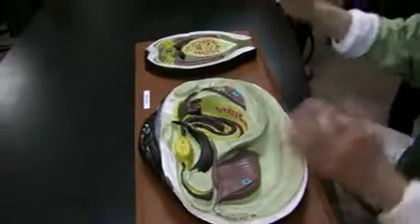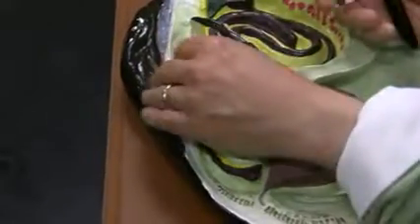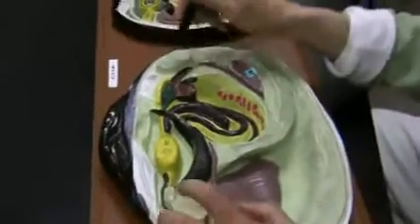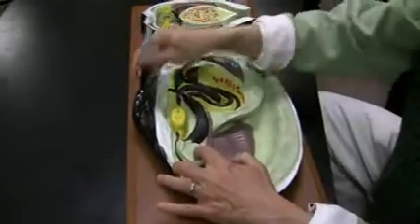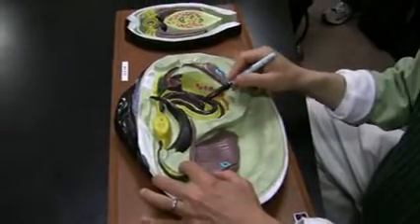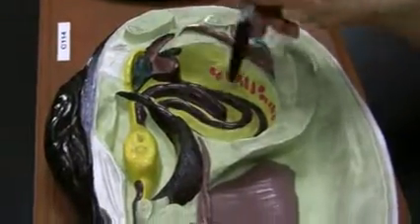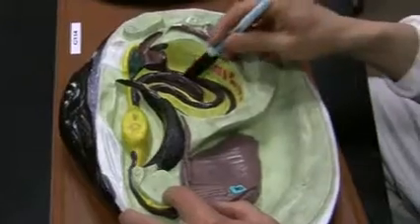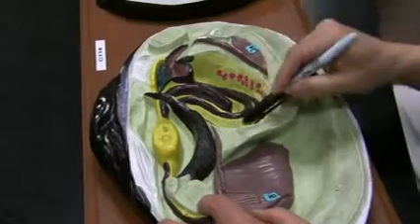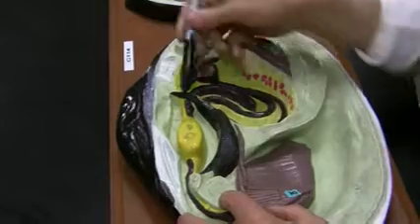Same model again, umbo. These are teeth, they call them teeth. The hinge ligaments that I talked about in the lecture, they would be right around here to hold it together. Adductor muscles, anterior adductor muscles, posterior adductor muscles, palp, foot. Inside of foot you have a mouth in here, stomach, intestine, which goes back and forth. Outside of intestine, these yellow ones are gonads. I forgot to mention that in that one, but if you have intestine that wiggles back and forth, outside of it, right here, those are gonads. Okay, and it goes through the heart.